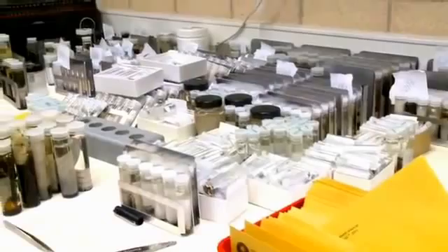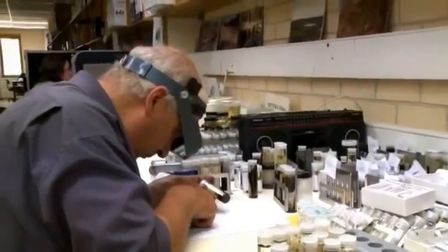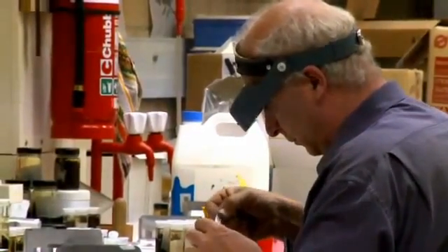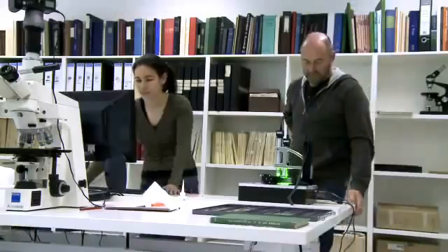The pollen microscope is also expected to make a big contribution to a very ambitious project. The Atlas of Living Australia is going to be the largest integrated aggregation of information about Australian species in forms that can readily be reused by researchers. We want to make the best possible future for this country, including the preservation of as much as possible of the biodiversity around us. In order to do that, understanding what we've got now — its needs and characteristics — is the baseline from which everything else will follow. Pollen is something that can very often be identified through the kind of automated processes we're talking about.